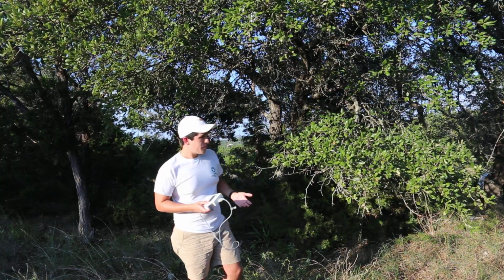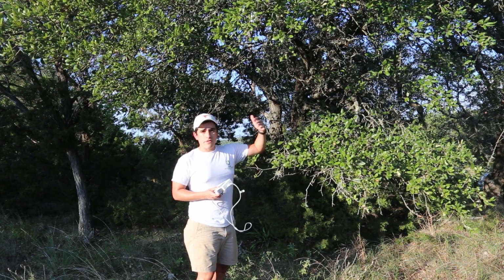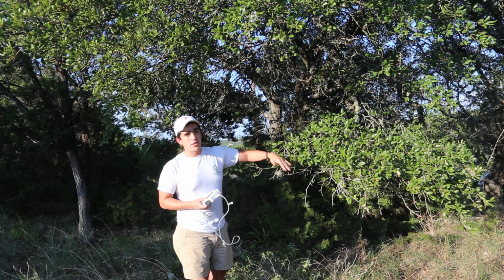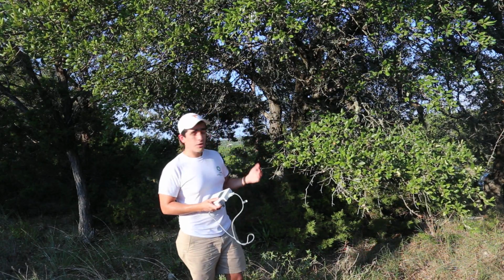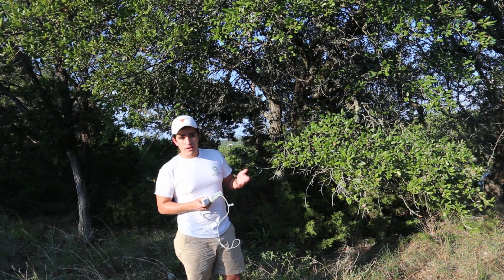At this point, even though these are shrubs, these are trees, the conditions are favorable due to the low vapor pressure deficit that exists at this time of the day. So right now we actually expect to see higher transpiration rates from trees than, say, for example, at 12 or midday.